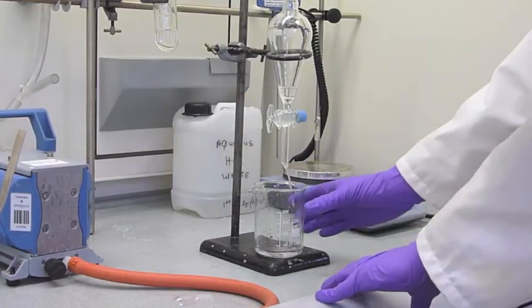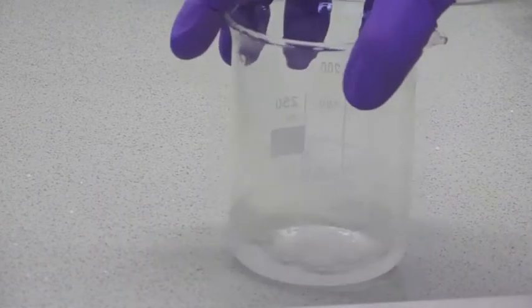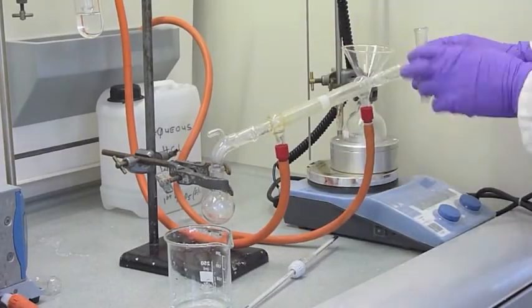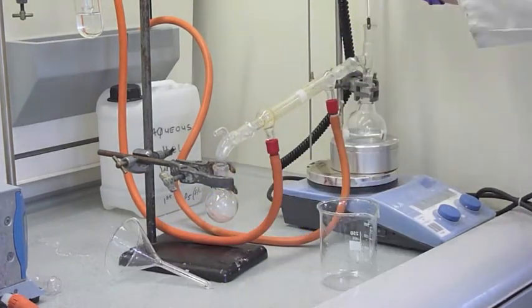The organic layer was then run off, and dried over anhydrous magnesium sulphate. Finally, the distillation apparatus was set up, and the oil purified by distillation.